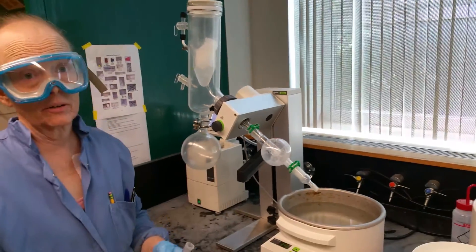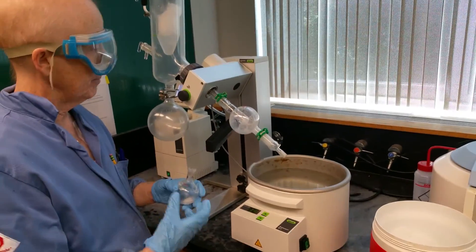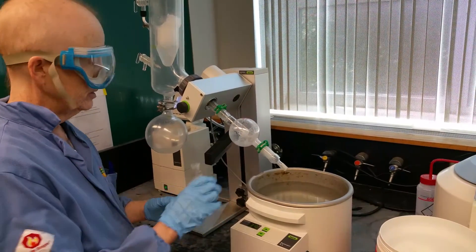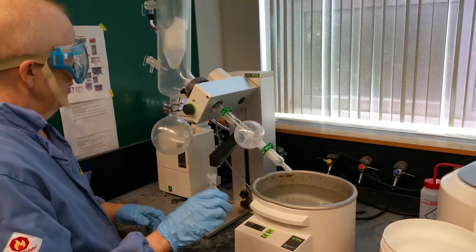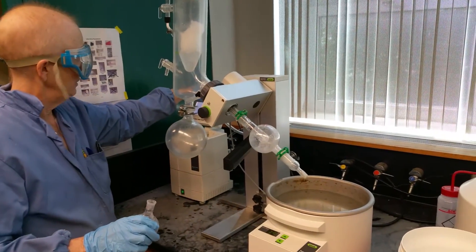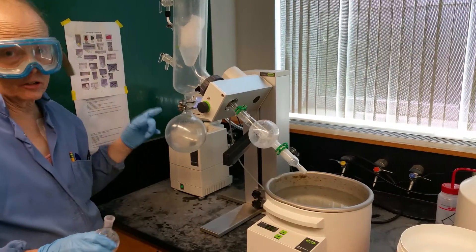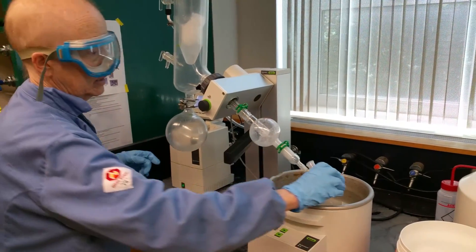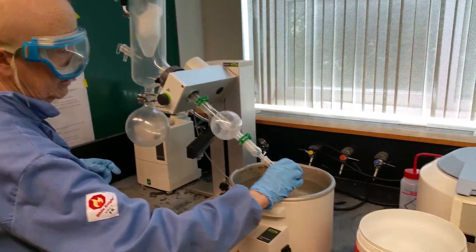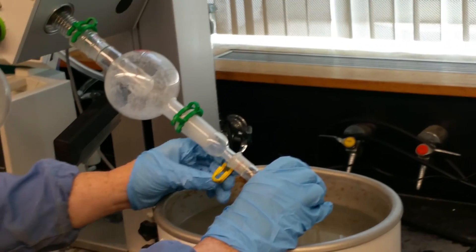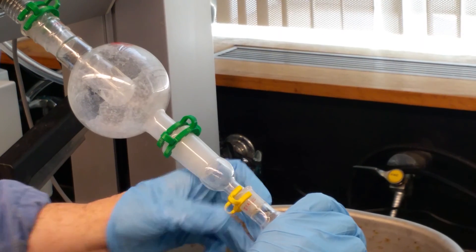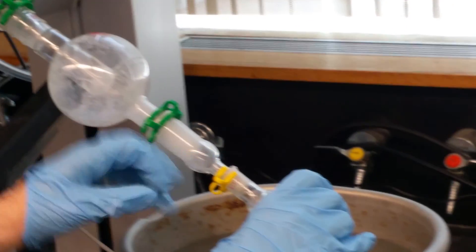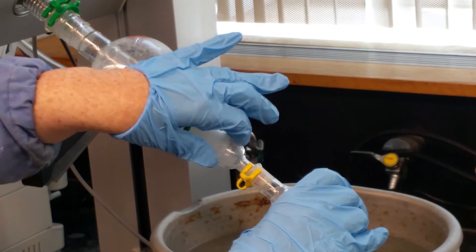I'm going to be a little rough on it again. You'll notice there's a lot of material deposited up in this trap. This is a trap. And this trapped the compound. I could get this compound out if I want to. I could just take this off, rinse it with acetone, and I could recover it. Why did I get that bumping action? Because I kind of started it up a little rough.